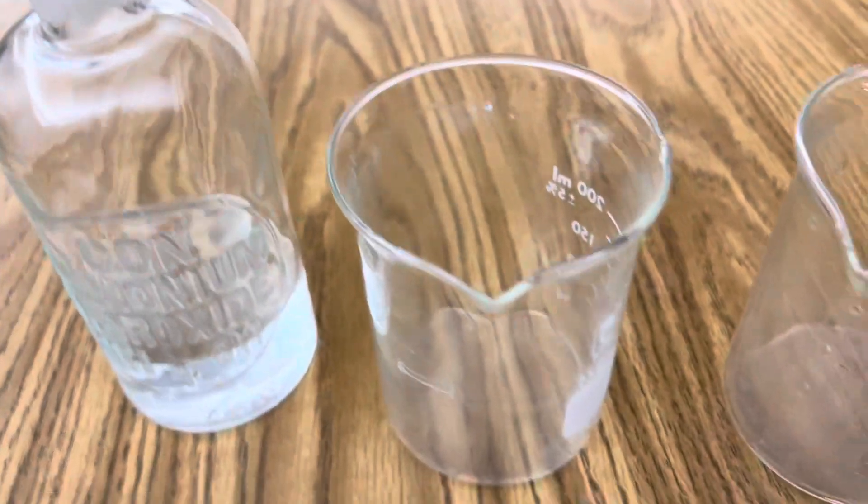Next, do the same with your ammonium hydroxide — a very small amount. Once both beakers have been coated, the ammonium hydroxide rolled in one and the hydrochloric acid in the other, if you're clever you can make it look like those two beakers are empty.